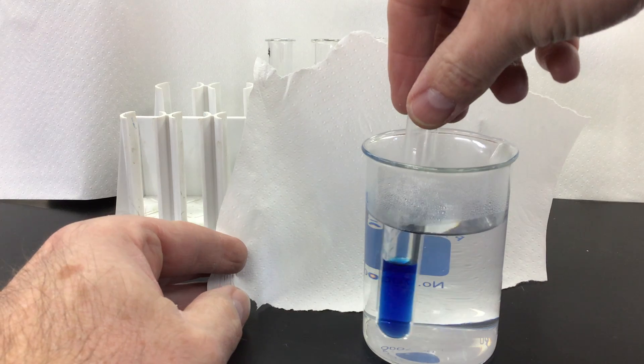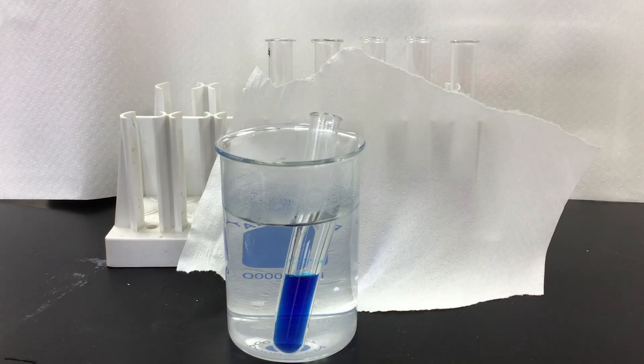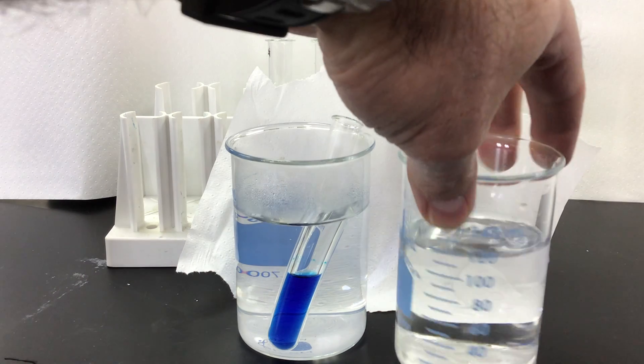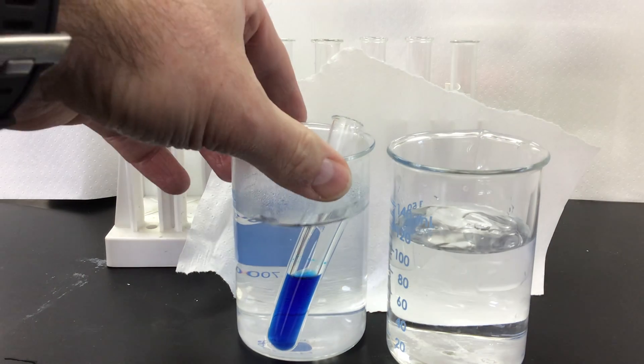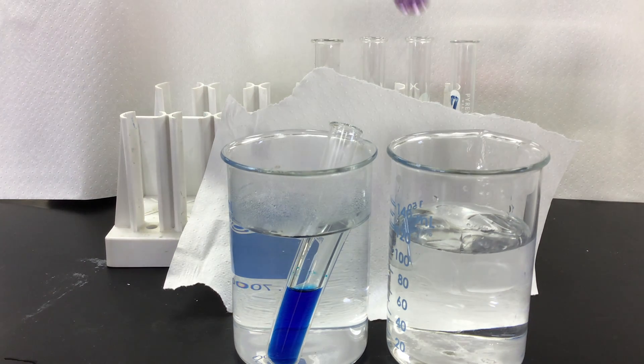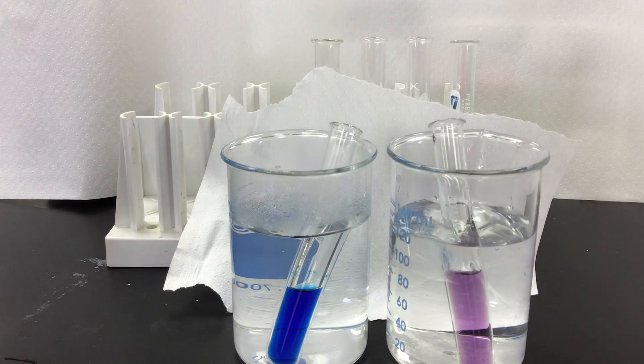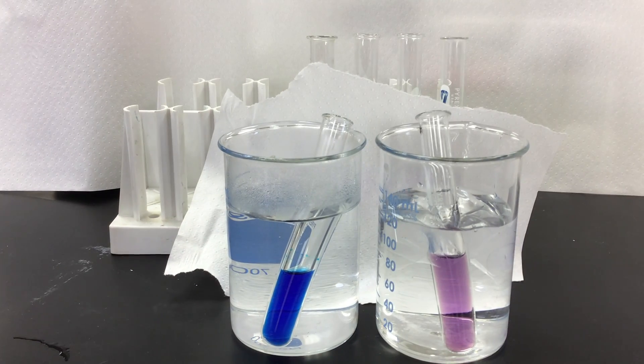Now I'm going to contrast that with some cold water. I've got a cold water bath here and let's see how our color change may occur. Same solution, kind of a purple color here, and let's see how this one changes with temperature. That one definitely is looking like it is turning more pink.